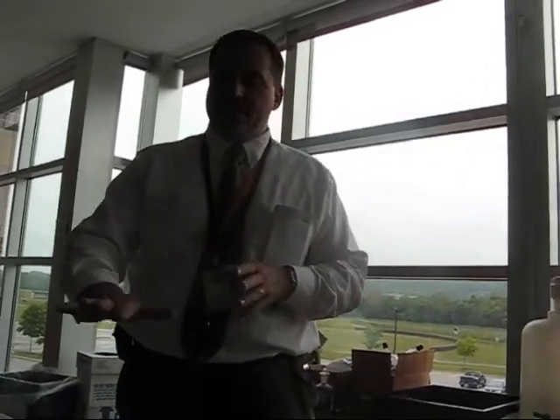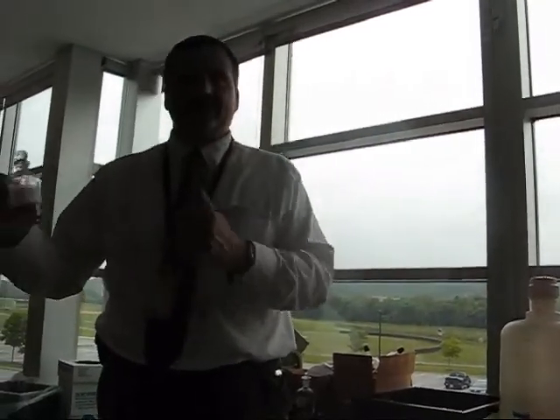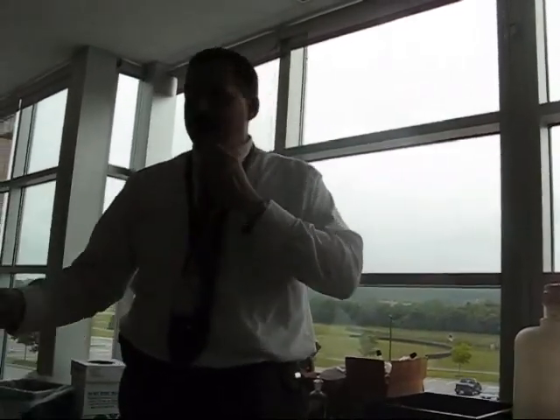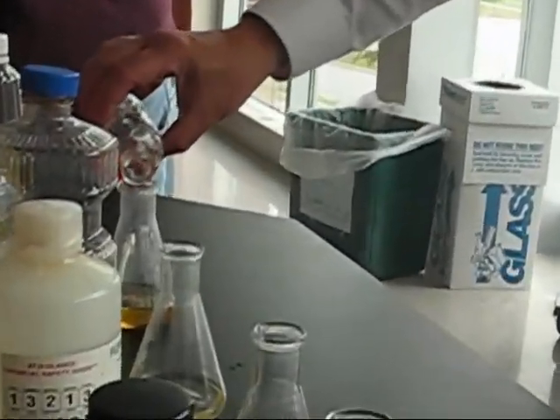The bromine actually reacts with double bonds only under these conditions. You can make it actually react under a strong light. So yeah, this is the classic test. Now, I might as well just use up this bromine because I have to remake this every year. So I'm just going to pour it in, and we'll just see.